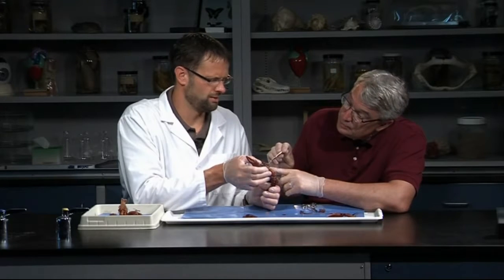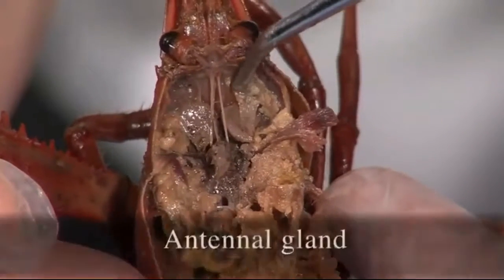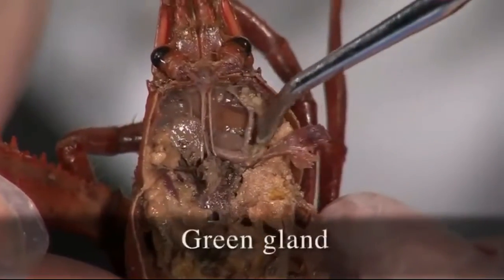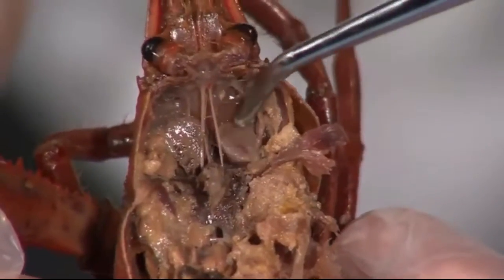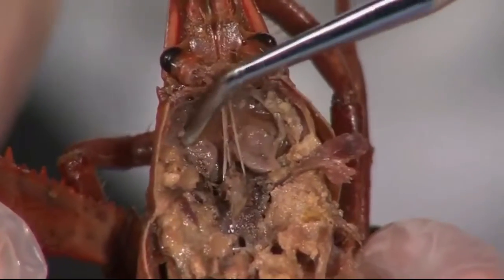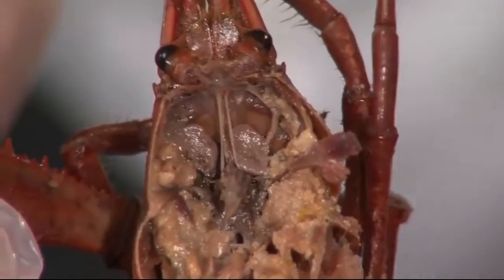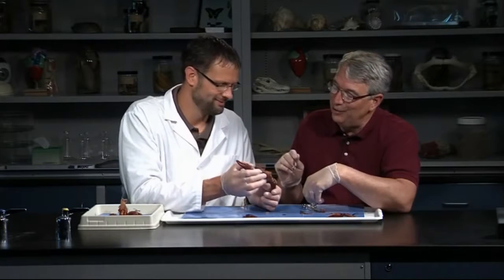How about any excretion? Yeah, excretion — getting rid of body waste. They have some specialized structures called antennal glands, also sometimes called green glands. These antennal glands are right at the base of the antenna. When you remove the stomach, there's a pair of them here — these sac-like structures right here and here. They take body fluids, remove the waste from the breakdown of metabolism, concentrate those wastes, and excrete them to the outside through an opening. It's basically like peeing for crayfish.